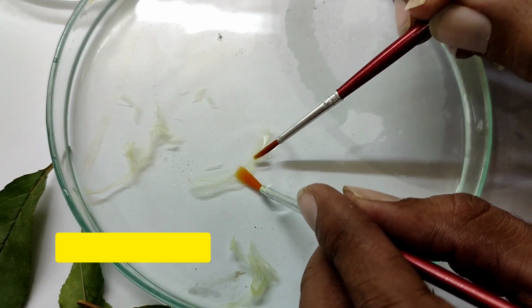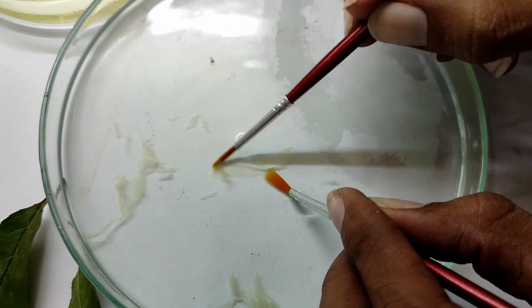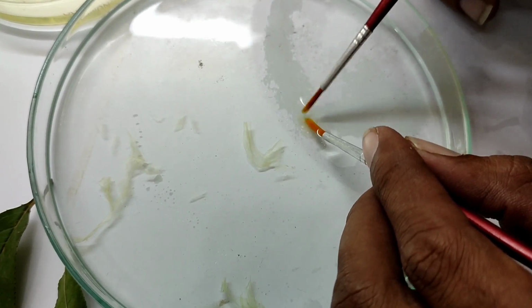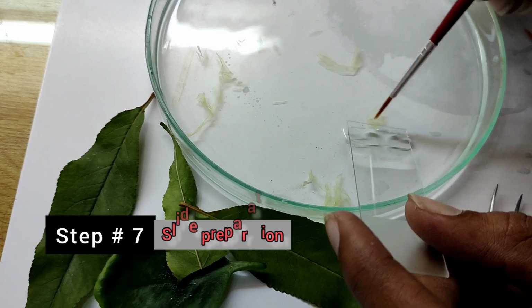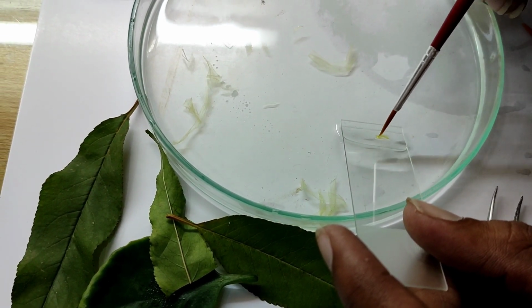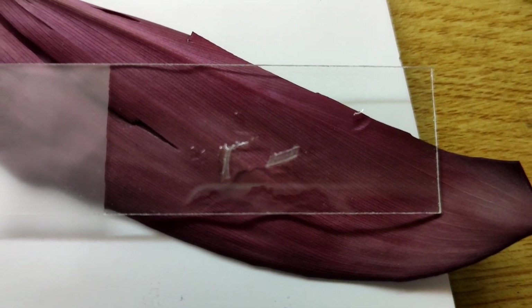Here you see the camel brush is used to remove the debris from the peel of the leaf epidermis to make this leaf epidermis cleaner and neater for slide preparation. So this is another important step, removing the debris from the peel. Now we put this small piece of leaf peel on a slide. Here you see we have put 2 small pieces of the epidermis on a glass slide.